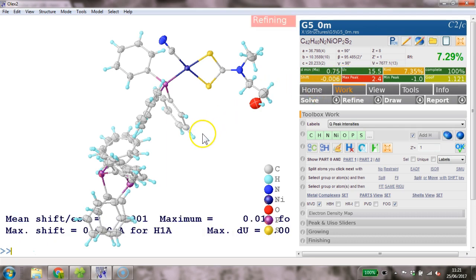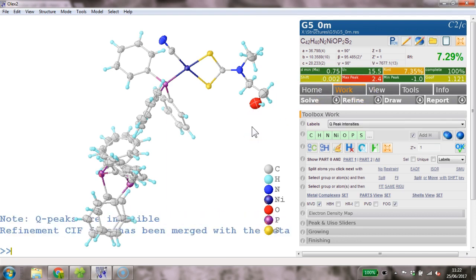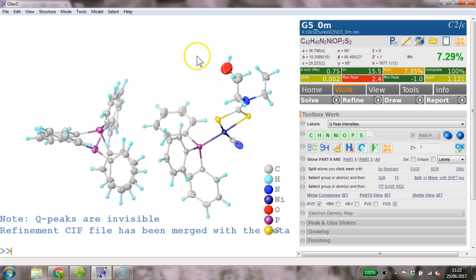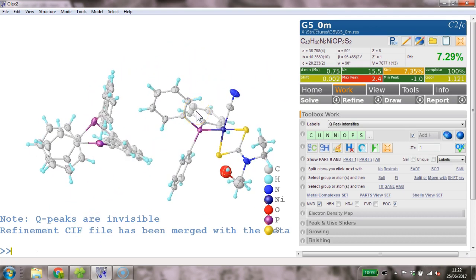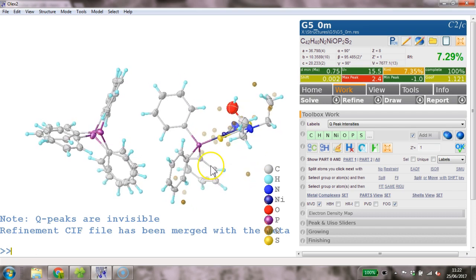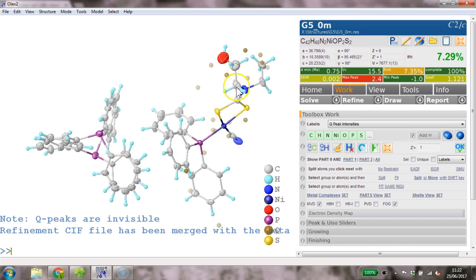As I said, I have no suggestion about this Q peak. It's big, it's there, it needs to be explained. I don't know what it could be, and that is probably for somebody else to sort out. Last check about the Q peaks around this area. Yep, I think there's something going on that is not to do with this disorder. I don't think there's disorder here that we can model in a meaningful way.